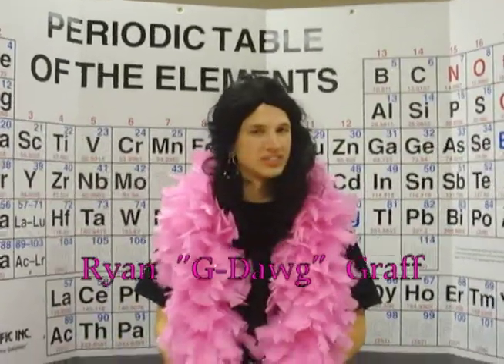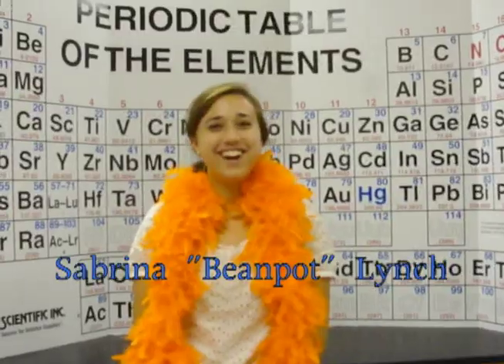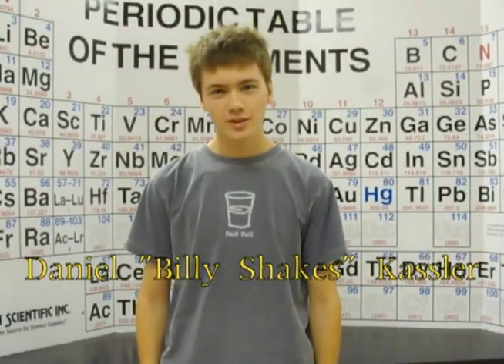Johnny was a chemist. But Johnny is no more. For what he thought was H2O. Was H2SO4.